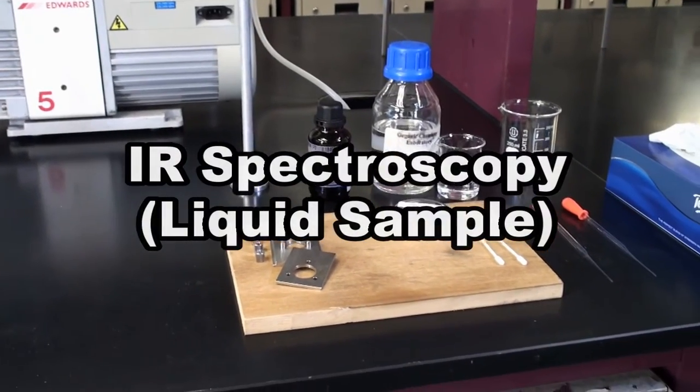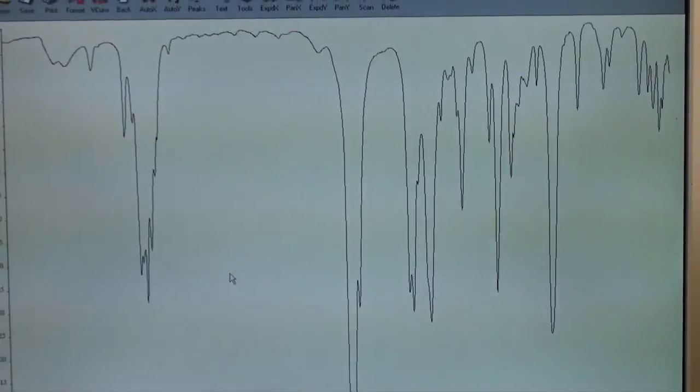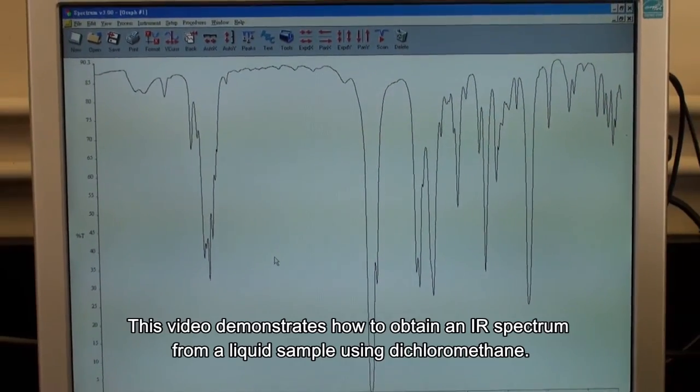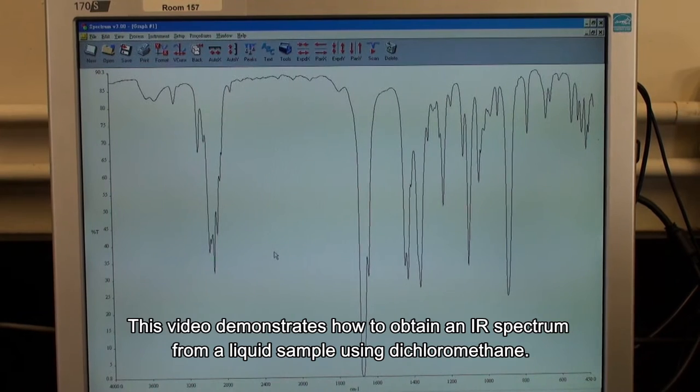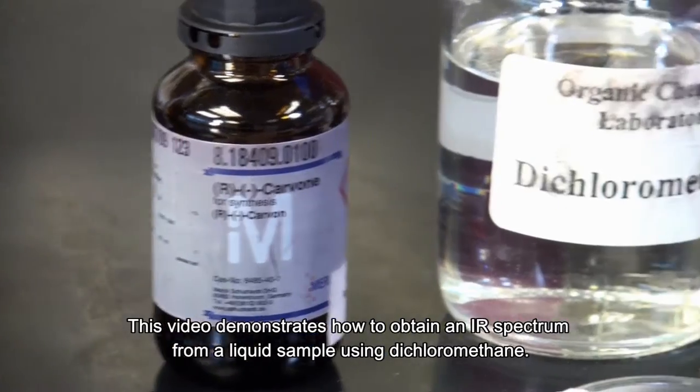Infrared Spectroscopy Liquid Sample. This video demonstrates how to obtain an IR spectrum from a liquid sample using dichloromethane.